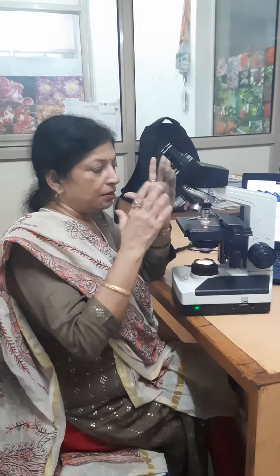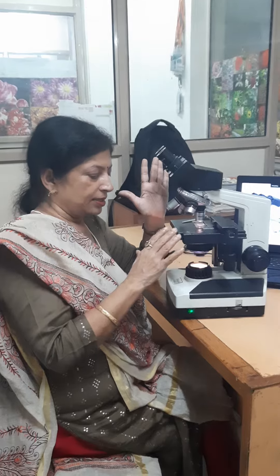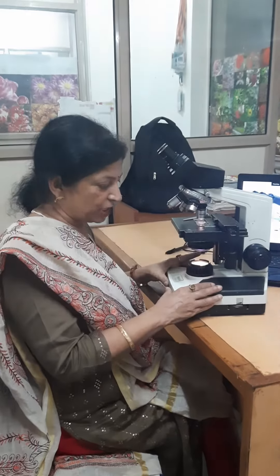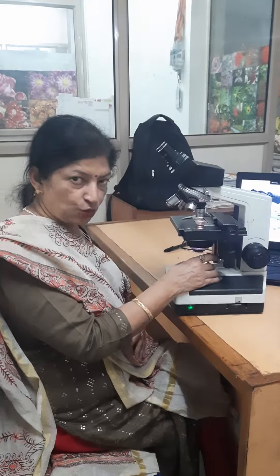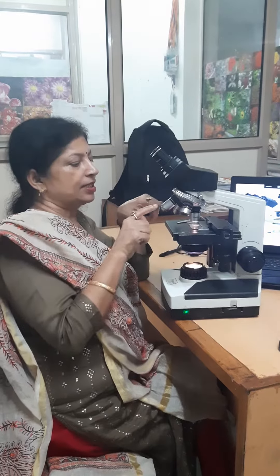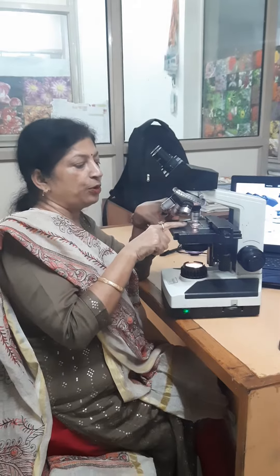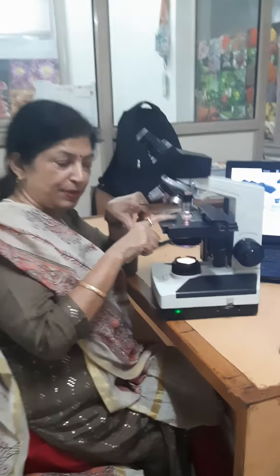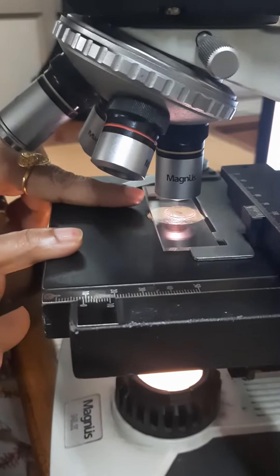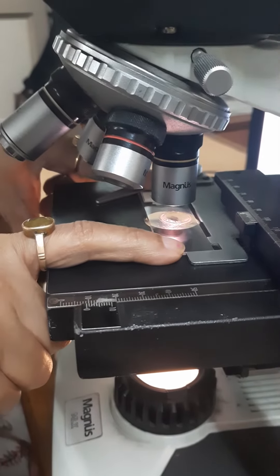The main parts of the microscope are — starting from the very base — this is known as the base, then there is the light source, then the condenser, and the platform where the specimen is placed. The specimen is some tissue on a slide.